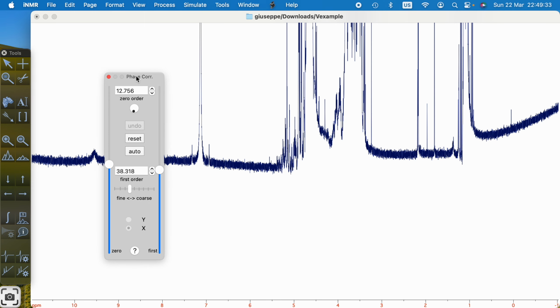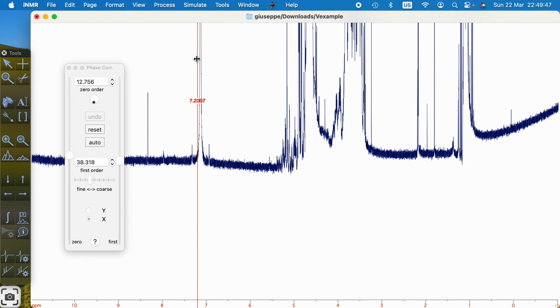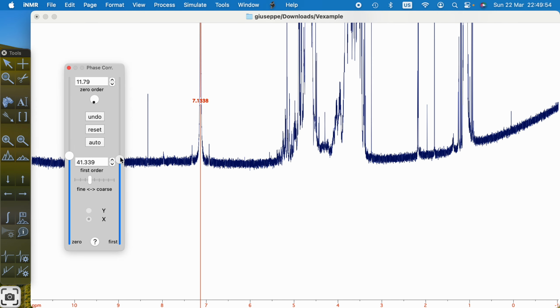Phase correction, but this time is manual phase correction. Press the key command and click the mouse. This mark is movable. It means do not change the phase of this peak if I use only this thumb. Okay. Look here, this is a little better. Move to fine.